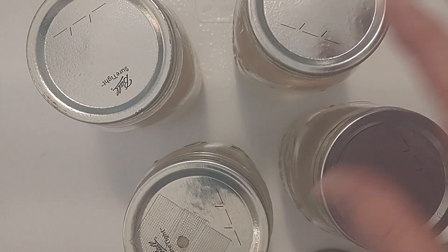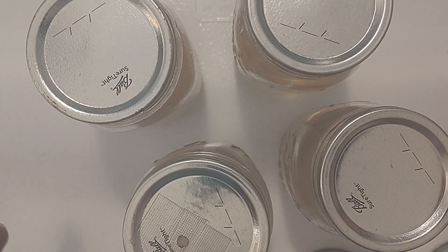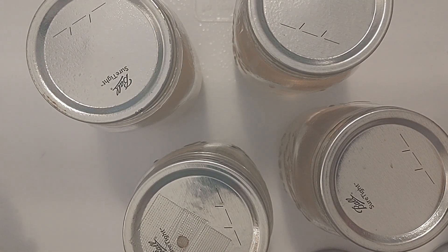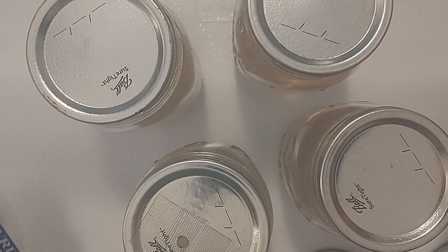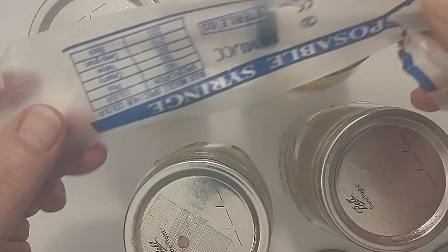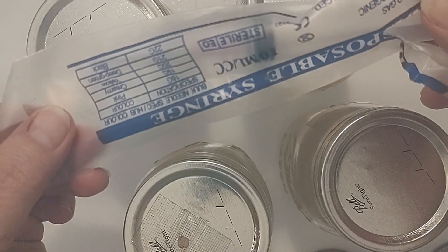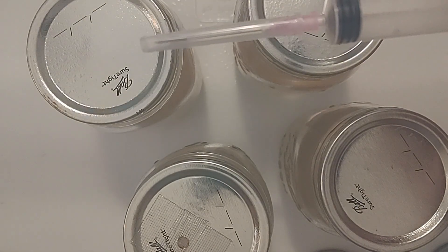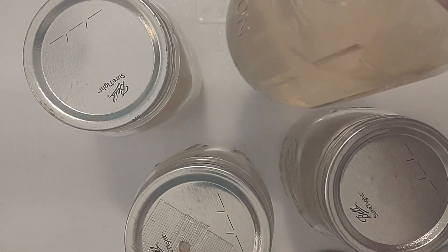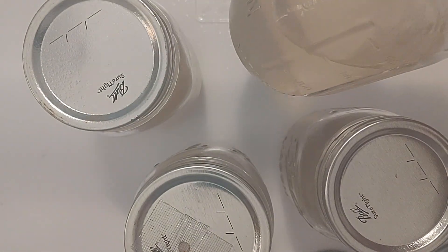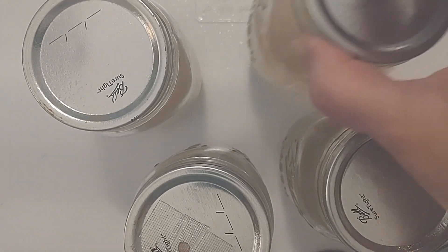My hands are covered in alcohol. We usually wear gloves, however I've got too much going on here and I'm videoing. So we have a sterile brand new syringe and I have two brand new LC jars right out of the pressure cooker here.